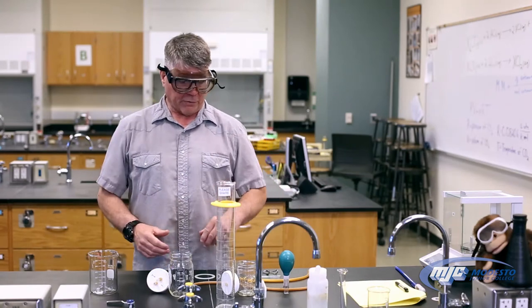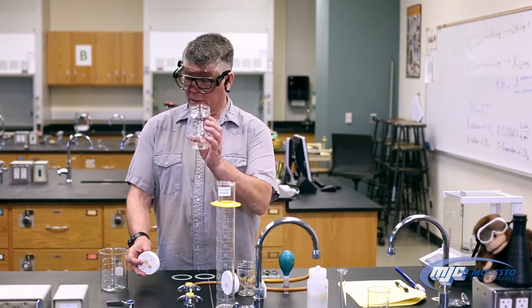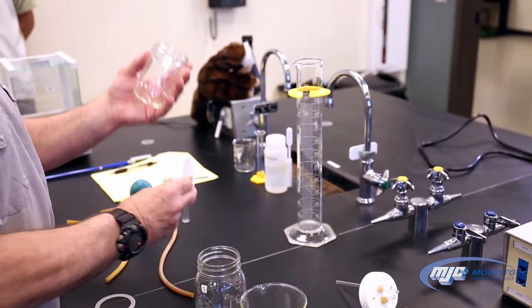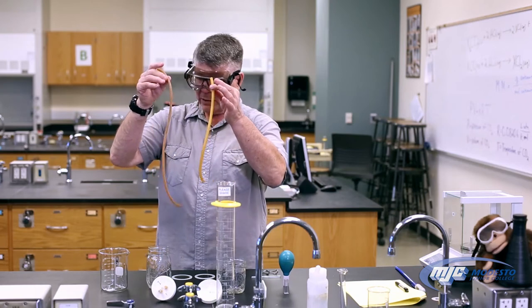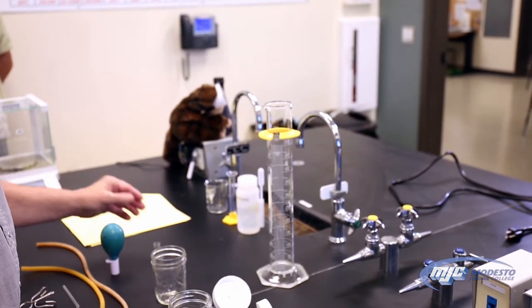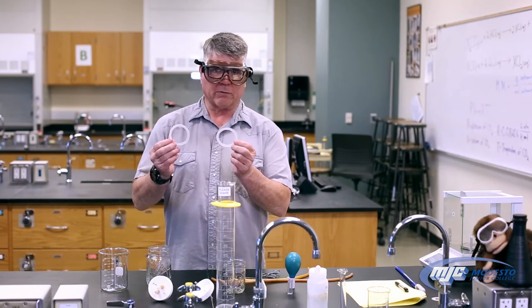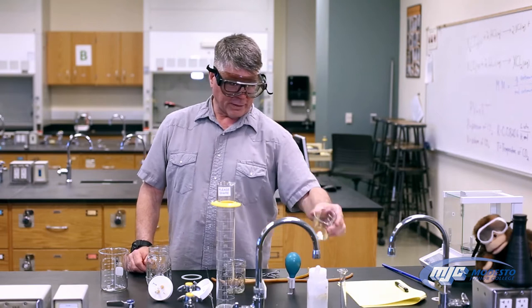This is the setup for the gas law experiment. You'll need a 600 mL beaker, a quart-sized mason jar with a matching lid — lids are paired to specific jars, so make sure yours have the same number — a pint-sized mason jar whose lid has one piece of glass tubing, two pieces of rubber tubing, one plastic cuvette, a pipette bulb, a short piece of glass tubing, a pinch clamp, two gaskets, a digital thermometer, and your 150 mL beaker from your locker. You'll also share a 500 mL graduated cylinder.